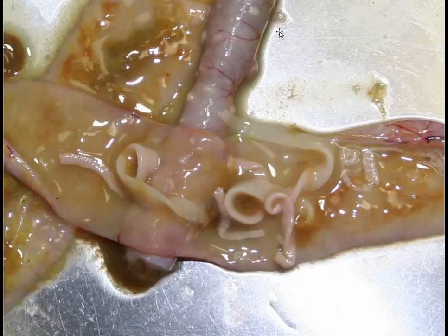You can see outpouchings and fibrosis of the wall of the intestine in animals that are infected with this particular agent. Notice I said infected, not infested. If you're a pathologist dealing with parasites, they are infections. If you are somebody who works for Orkin and you go out to people's houses and kill termites and ants, that's an infestation.